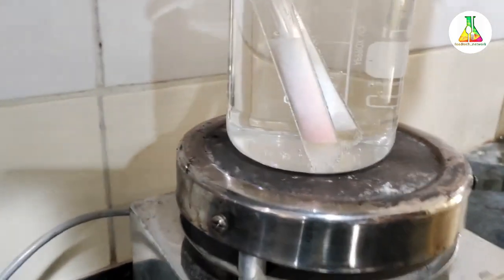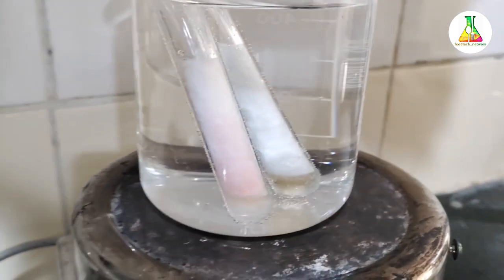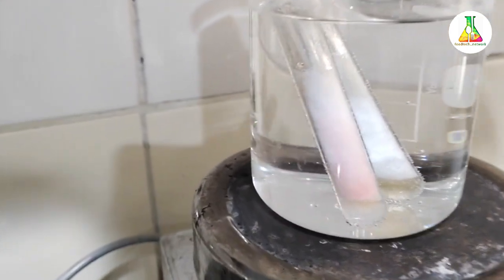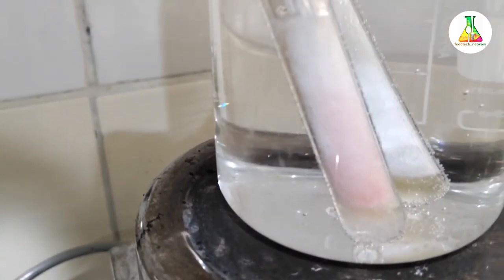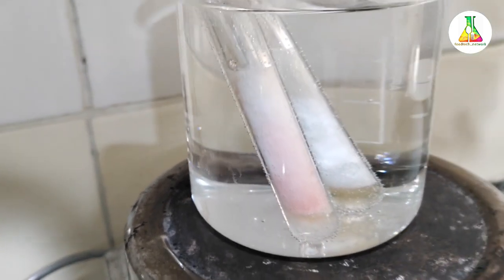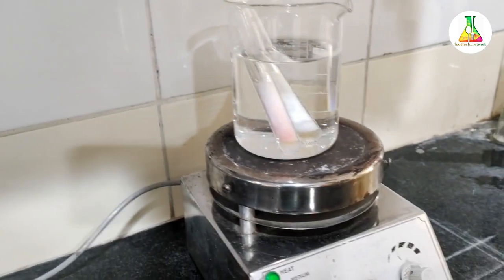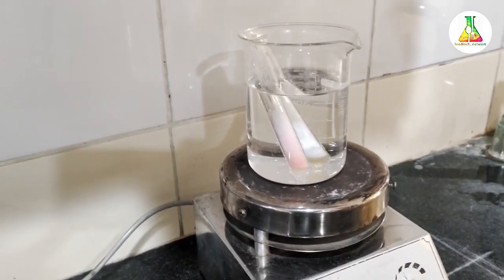You can now see that the test tube at the front has started gaining a red color. Initially it shows a light pinkish color, and after some more time you will observe a deep red color. This indicates the presence of sugar — in our case, cane sugar — confirming that this sample is adulterated.